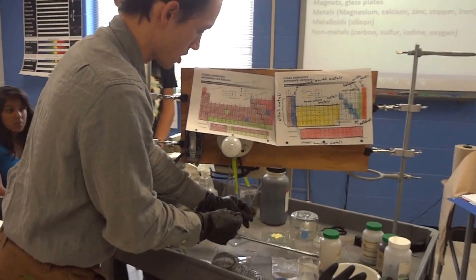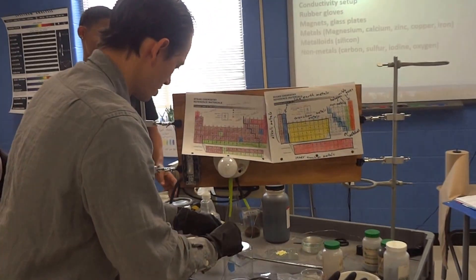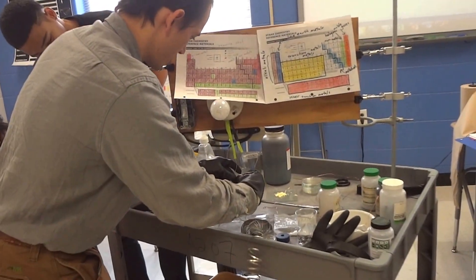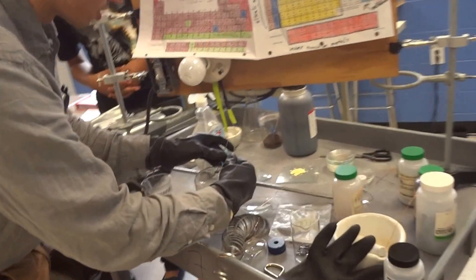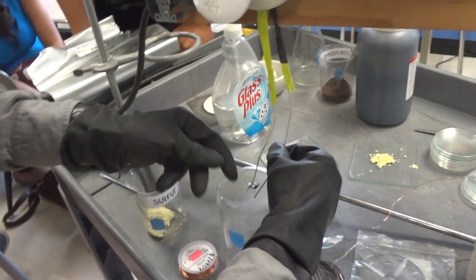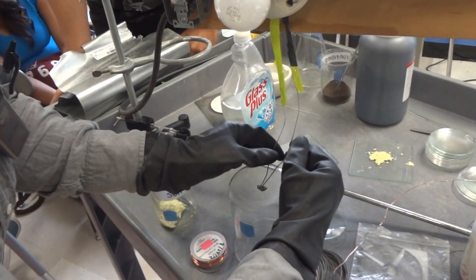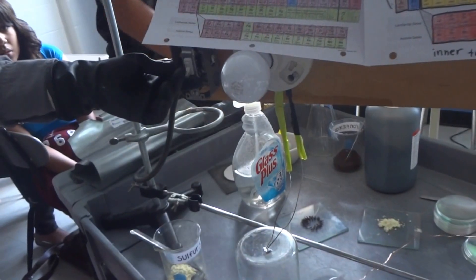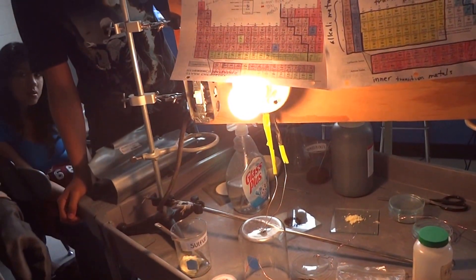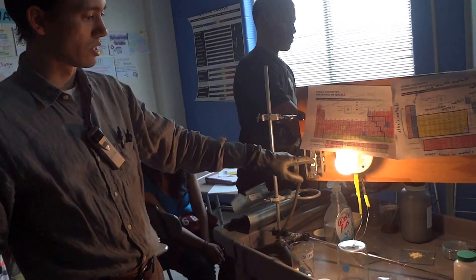We're going to see if we can get the silicon to touch the two wires — it's challenging because it's a tiny rock. Got it — it's on there. Go ahead and turn the lights off and plug it back in. Who thinks it's going to conduct? It's a metalloid, not a metal. Yes — it is a conductor! Silicon conducts electricity, which is why we use it to make computers — electricity needs to flow through the circuits.